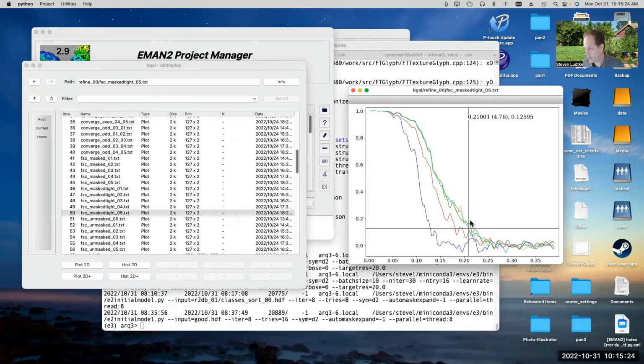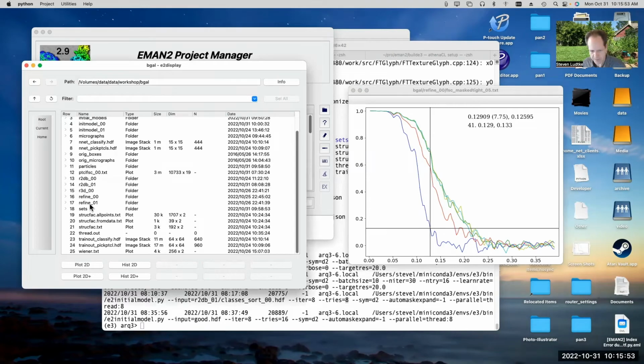Now, when I told it to refine, I only told it to target 8 angstroms. So that means that this result is not valid. The first iteration had already gotten past 8 angstrom resolution. So really, if I was going to use the fully sampled, unfiltered particles, I could have just run my full final refinement on this with a high target resolution and probably even skipped this because I started with a good initial model.